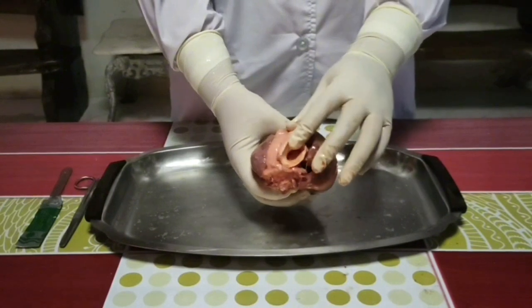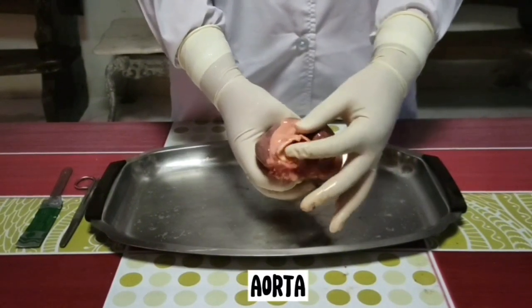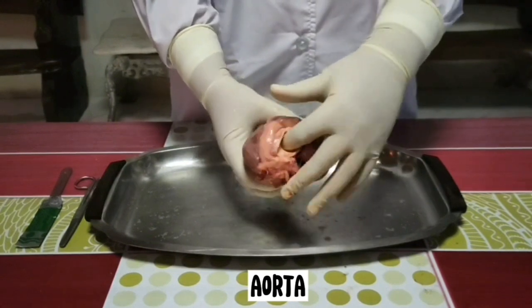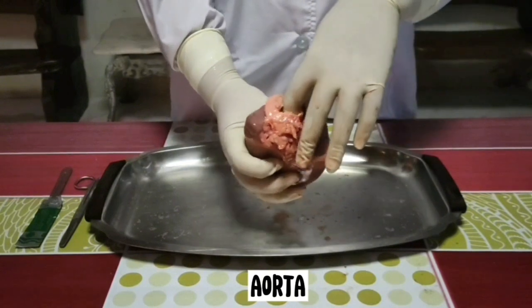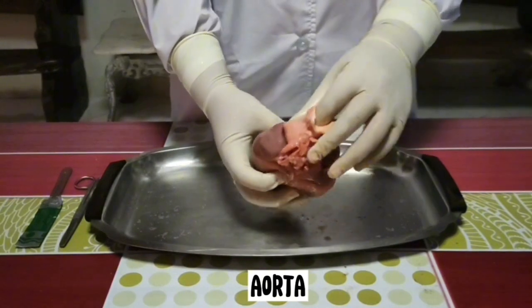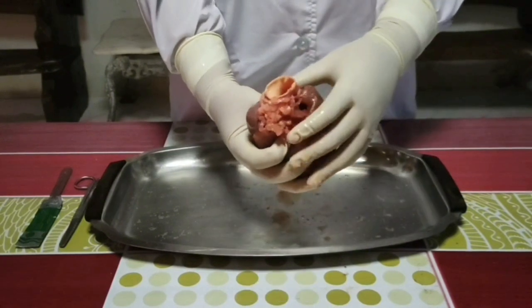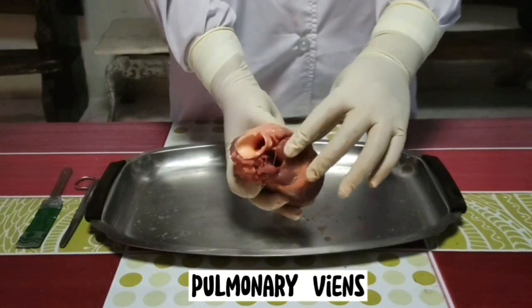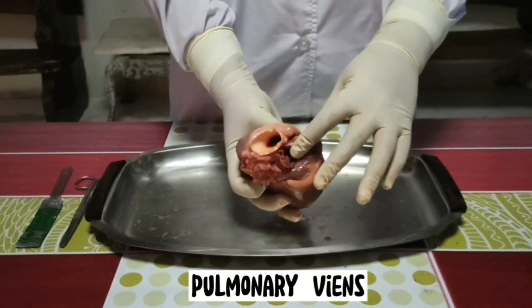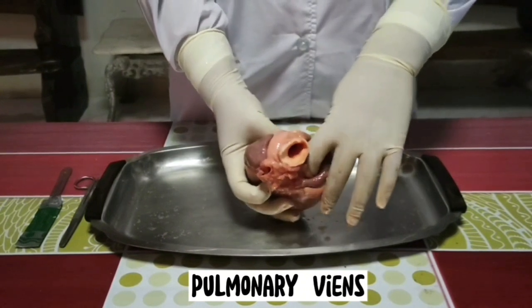And now, let's have the aorta. This is the major vessel located near the right atrium and just behind the pulmonary arteries to the lungs. Locate the curved part of this vessel known as the aortic arch. Branching from the aortic arch is a large artery that supplies blood to the upper body. We also have pulmonary veins, which are vessels that return oxygenated blood from the right and left lungs to the left atrium.